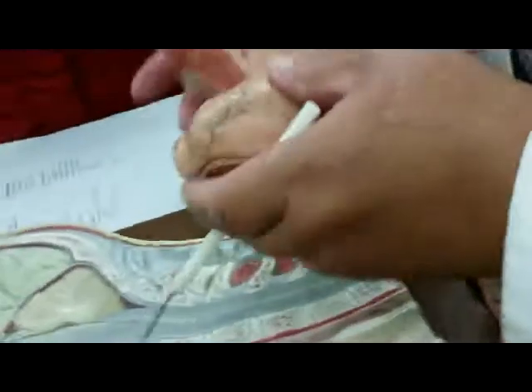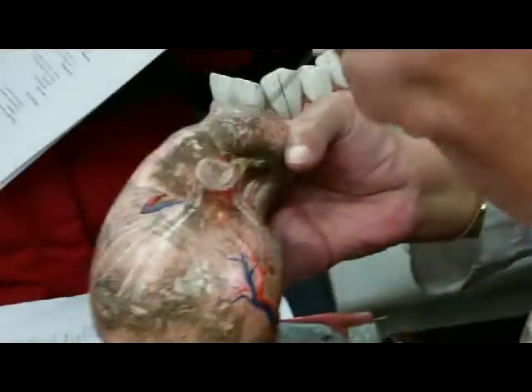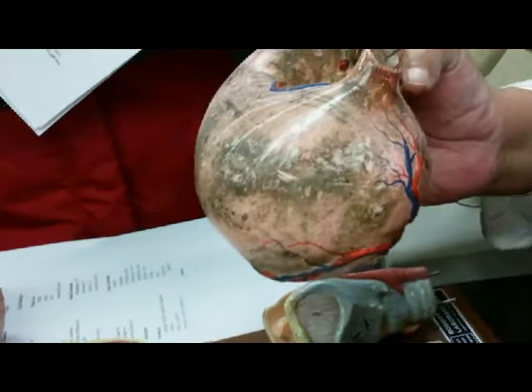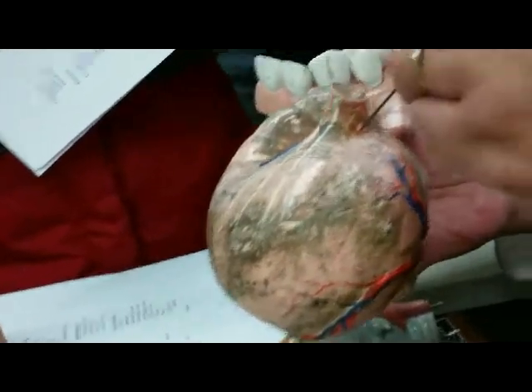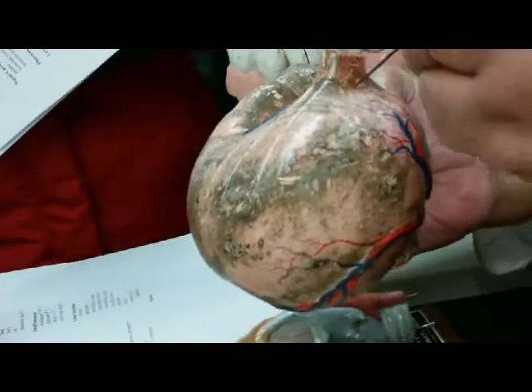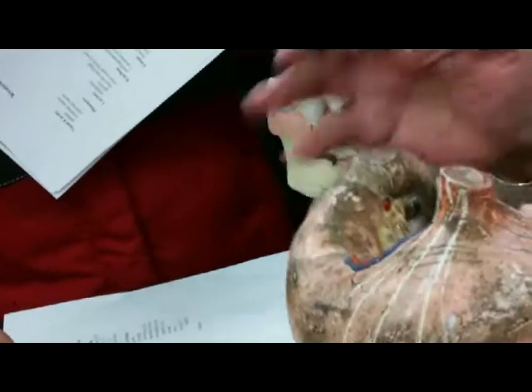Okay, we're not going to go inside of the stomach. Today you saw in the lecture that it's folded, but it's called rugae, so I'm not adding anything there. This is also the stomach, showing the pyloric sphincter over there. Sorry, the cardiac sphincter, the cardiac region, fundus, the body, and the pylorus. But you can't see the sphincter because it's blocked.